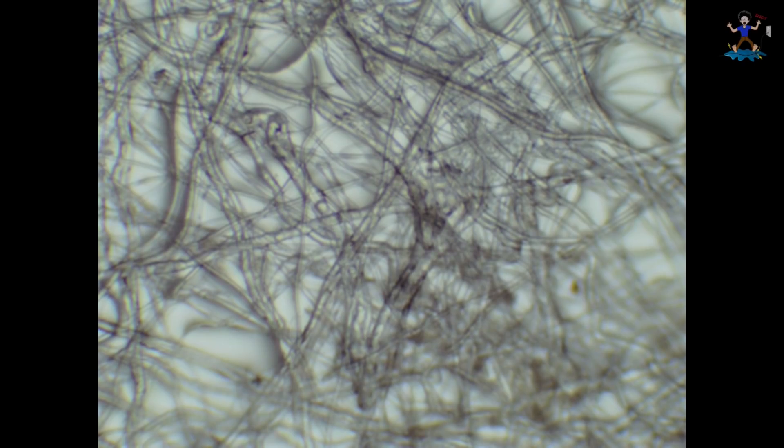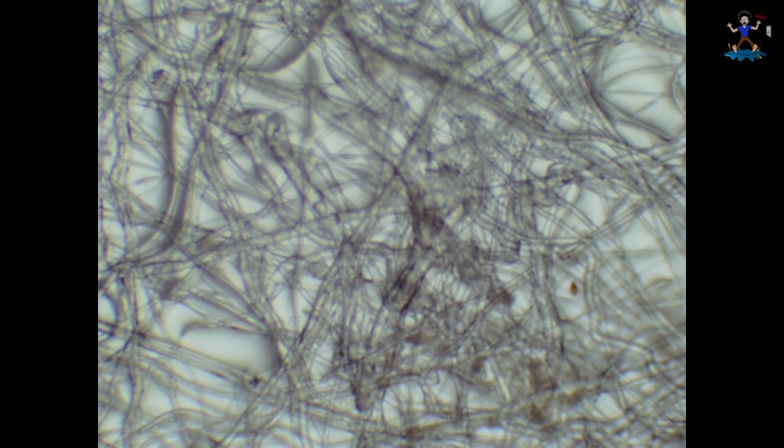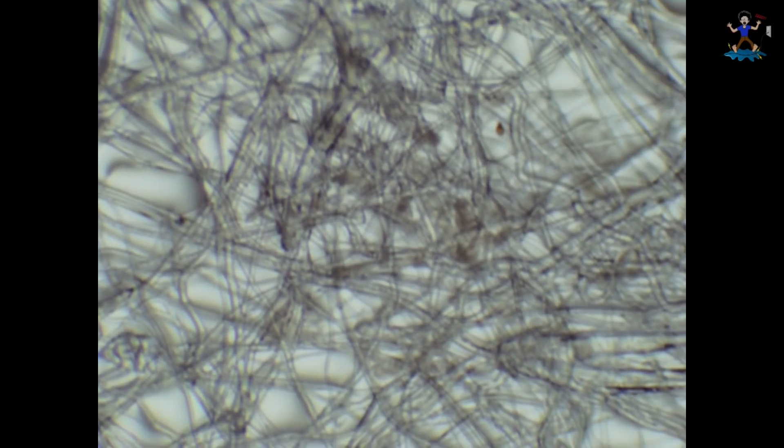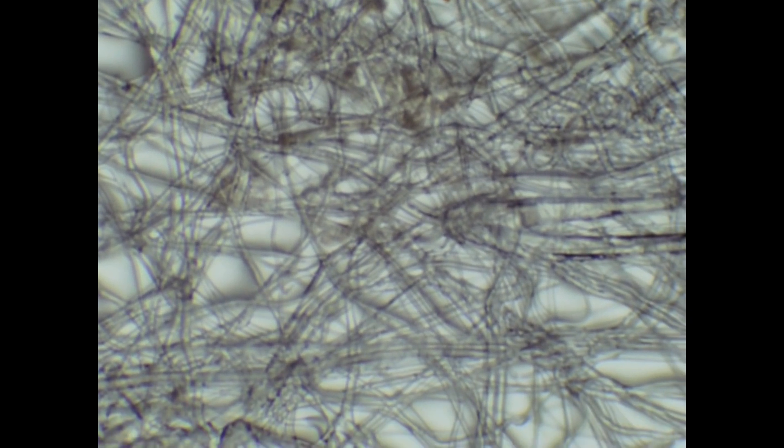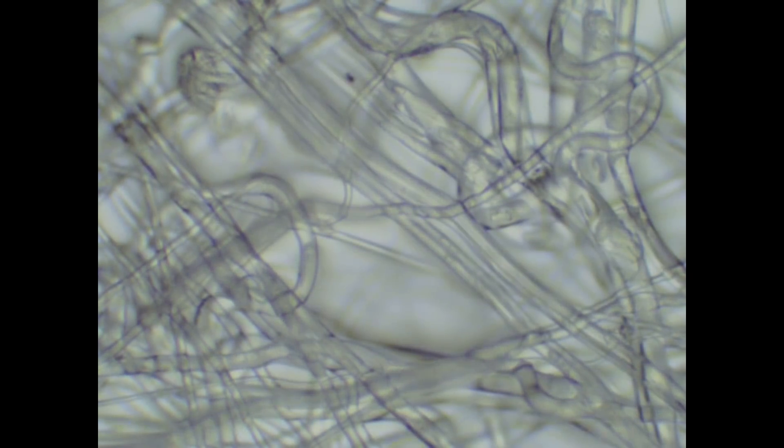Once again 40 times magnification. You can see that there's a wide range of polypropylene fibers, smaller fibers up to larger fibers. And there are some spaces between those fibers. Even though you see those spaces, when you adjust the focus of the microscope, you can see that inside those holes there are still some fibers that will prevent particles from passing.